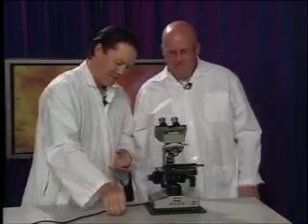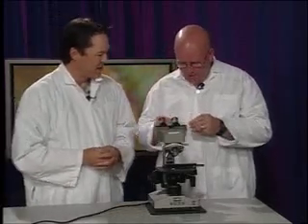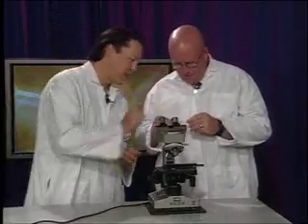Perfect. And those are the parts. Are you ready to look at something, Jeff? I am. Eric has prepared a slide for us. Looks dirty. Well, no, those are the things we're going to be looking at. We should see some freshwater crustaceans in there, Jeff.